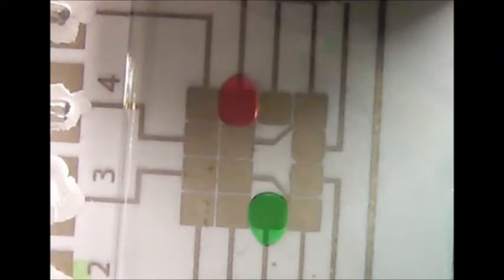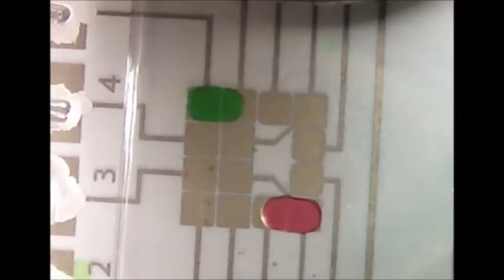Either way, it shows that splitting a drop is not that difficult if it's a big droplet, obviously. So, these are just 3 microliter droplets instead of the 5 microliter before, and they seem to go pretty well. Now the question is, will my splitting script work? Well, actually, first merging, I guess, which is just one drop. Okay.